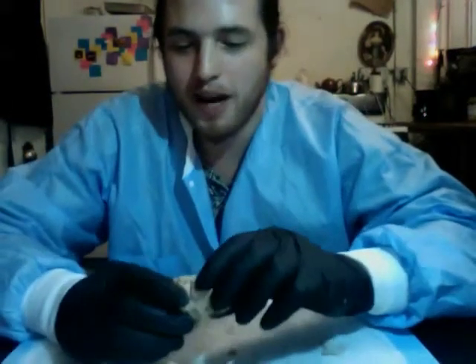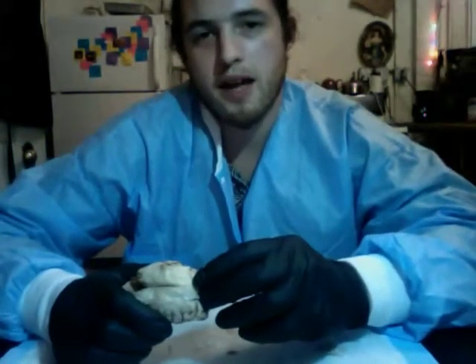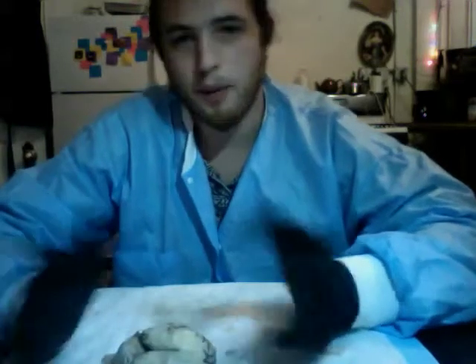a brain. And so what I intend to do here is to cut open this brain and show you some brain areas, and hopefully I'll be able to show you the three general brain areas that's discussed in the chapter, and talk a little bit about their general functions.